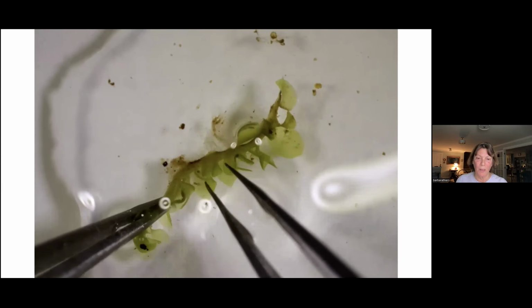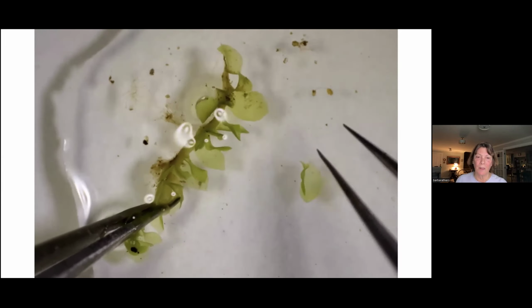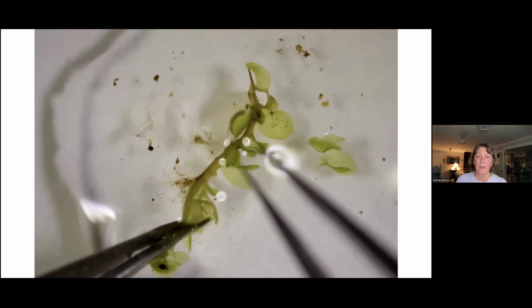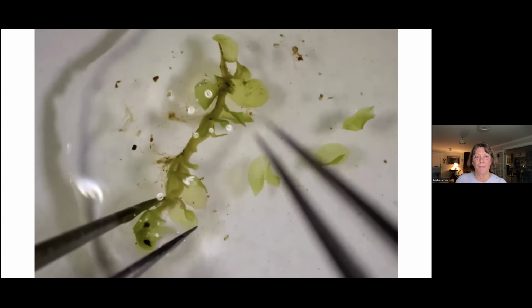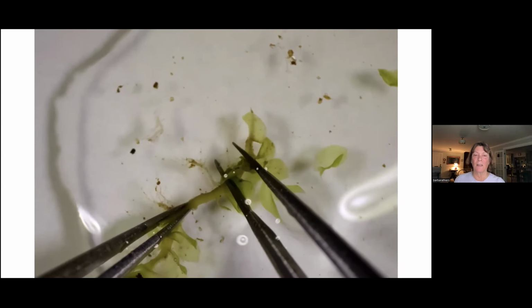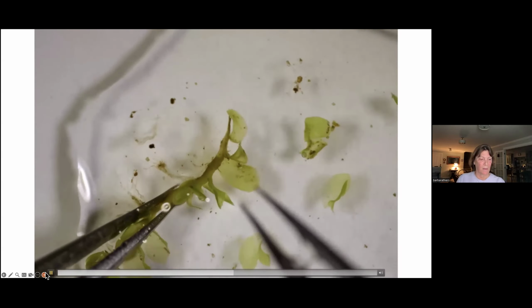I'll grasp it with forceps and try to pull off, I don't know, 5 to 10 leaves, depending, that I will then mount on the compound scope. So there I'm pulling them off. For me, it's often impossible to get absolutely the whole leaf. So I'm going to save a stem so that I can look at the leaf attachment on the stem, because once I've pulled them off, I'm going to miss some features. I'll say more about that in a minute.